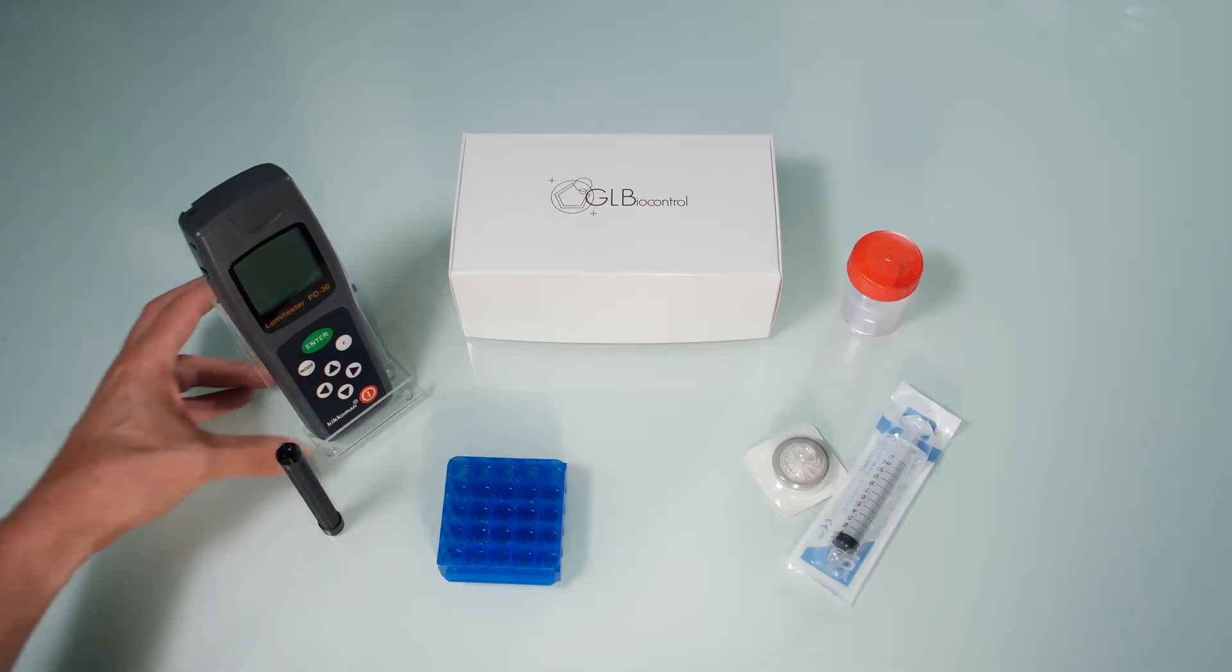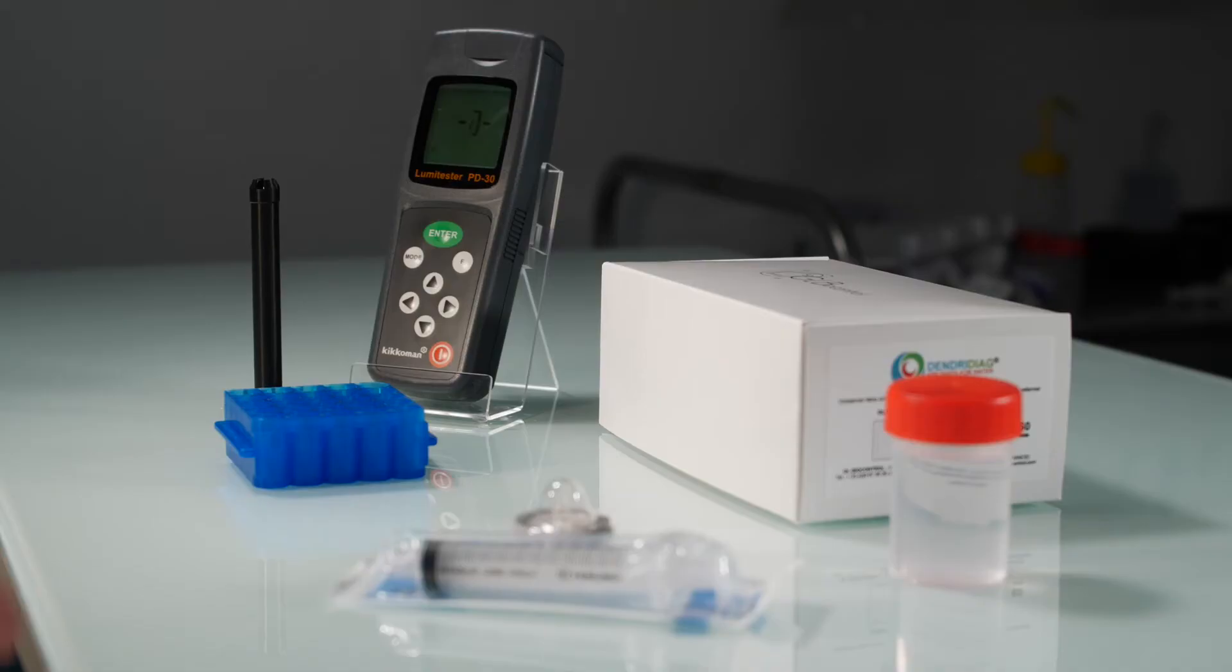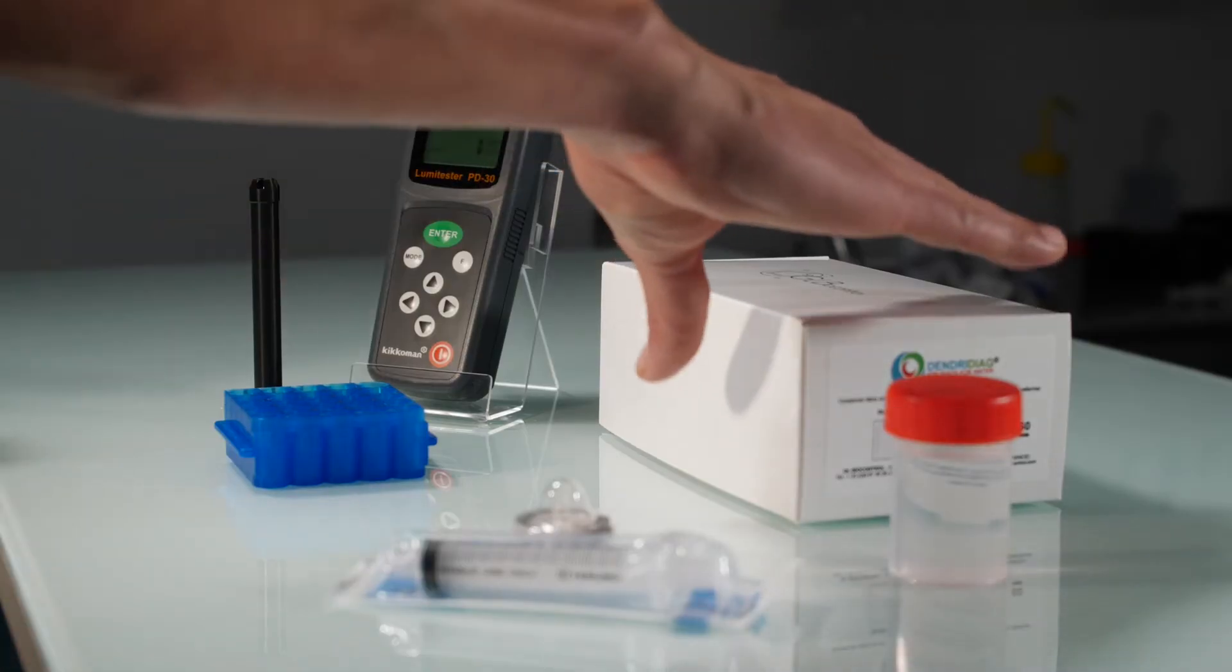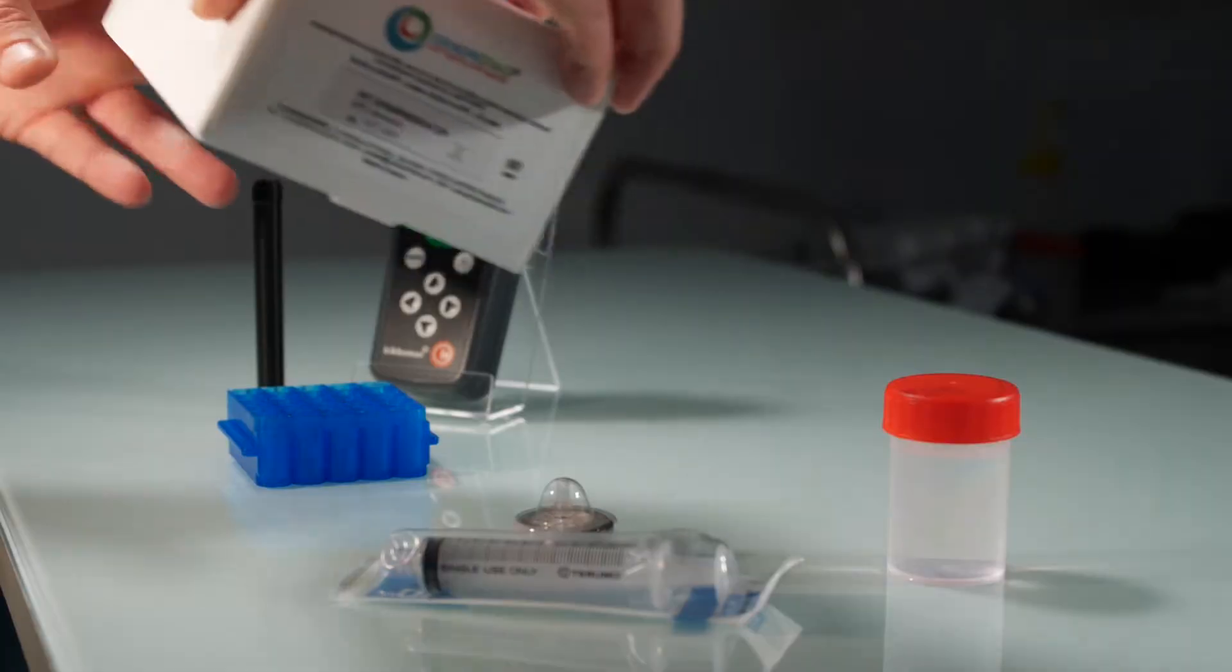Turn on the device, an 8 second automatic calibration will ensue. Ensure that the reagents are at room temperature before starting analysis.